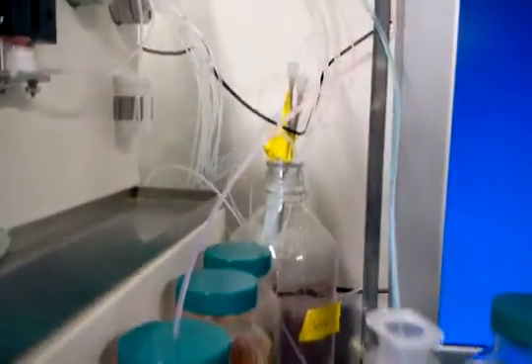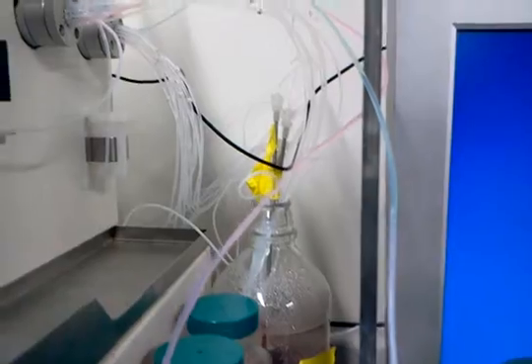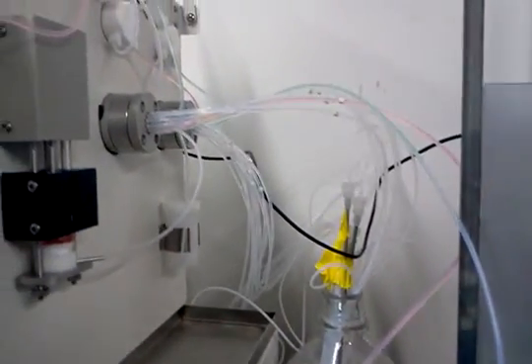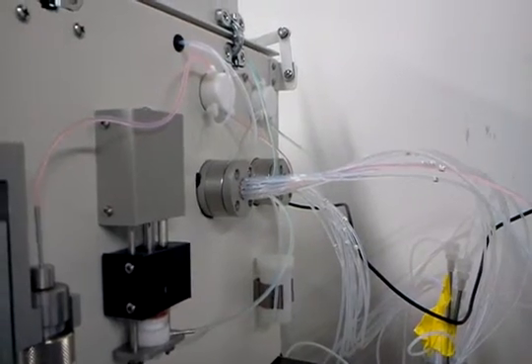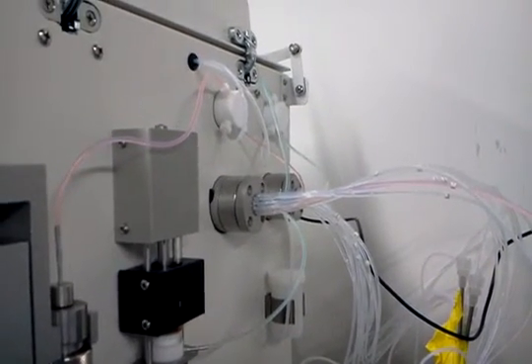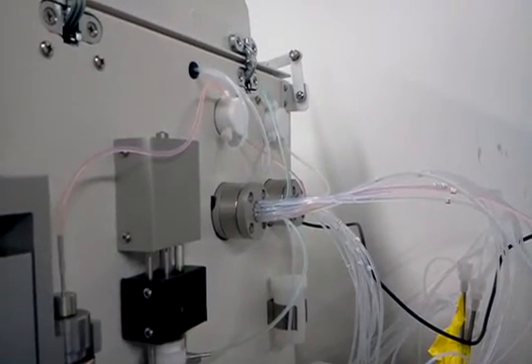If I track and follow the sample, you can see the end of the sample being pulled in. It will be pulled through the far nitrogen valve.